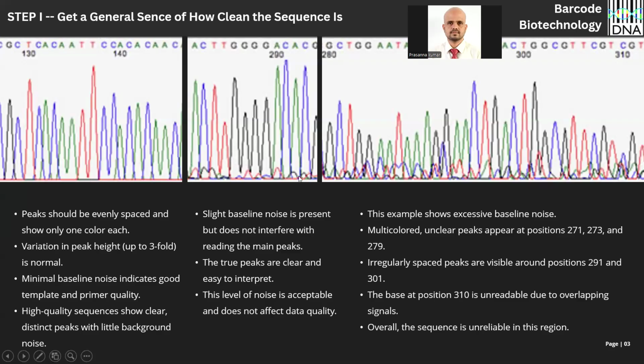This is baseline noise. Small peaks at the bottom of the baseline is a baseline noise. A high quality sequence shows very clear, distinct peaks with little background noise. This is a perfect chromatogram. But here, if you see, the baseline noise is present, but still it is okay because it is not interfering with the peak height or something. So true peaks are very clear, and this level of noise is acceptable.